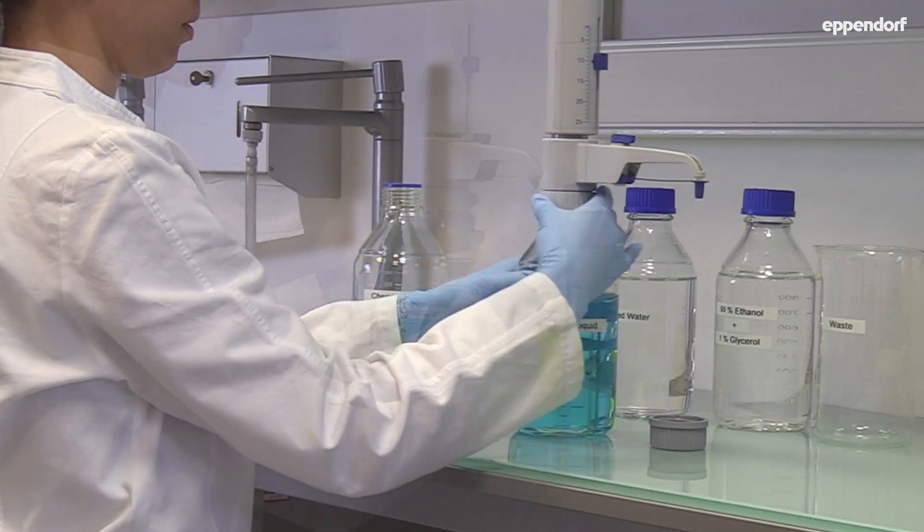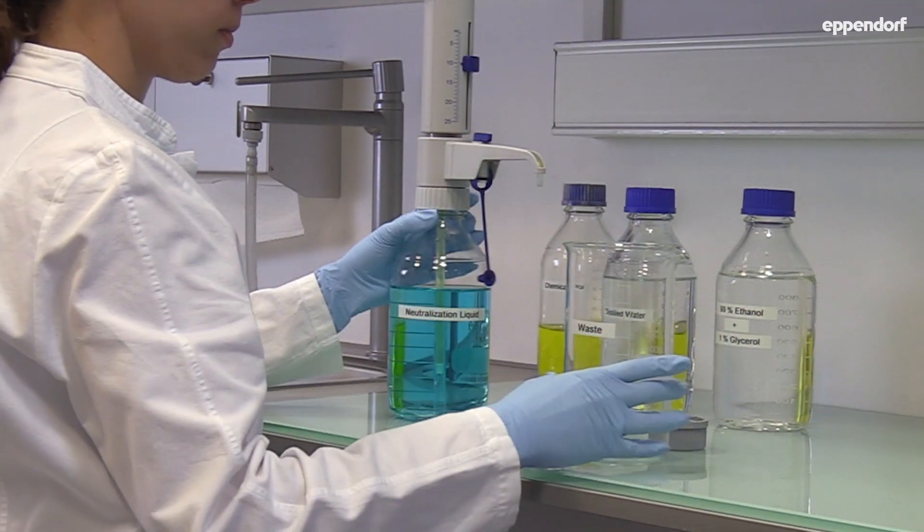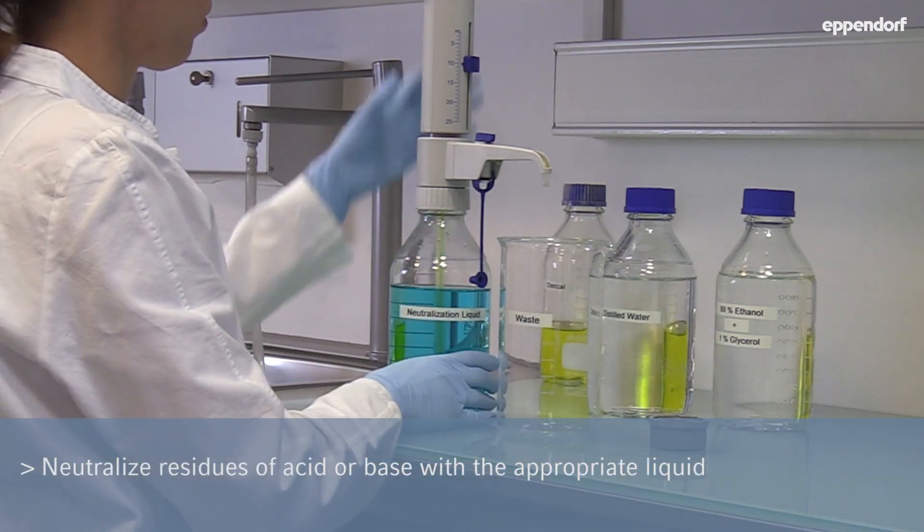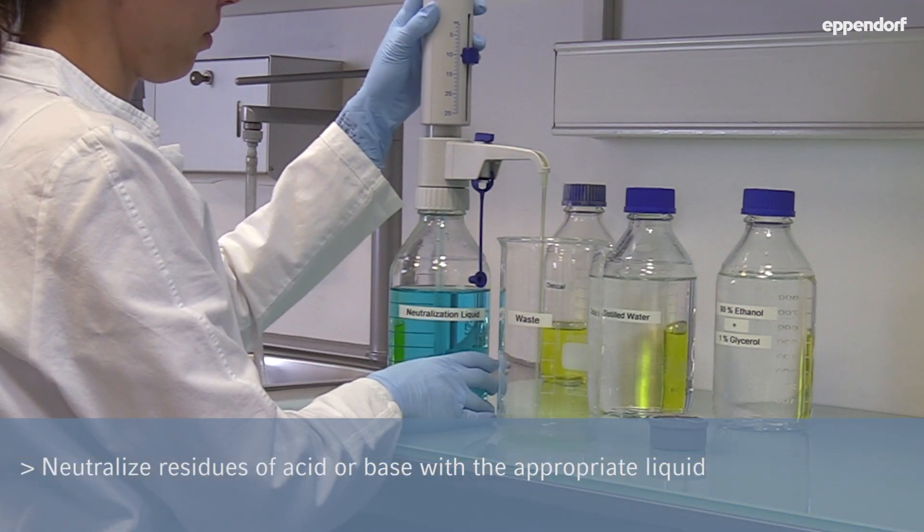First, attach the bottletop dispenser to the neutralization bottle. Rinse the device with the neutralization liquid.